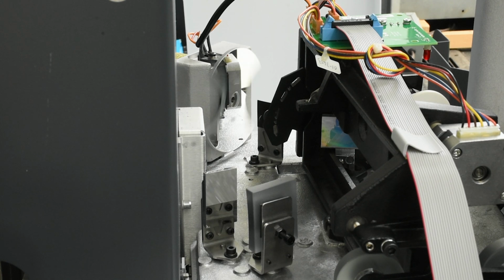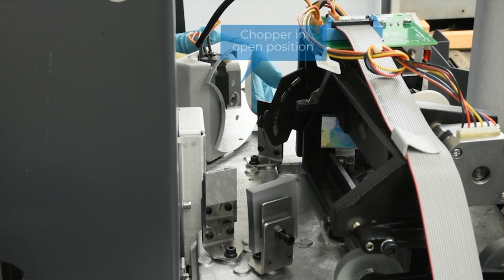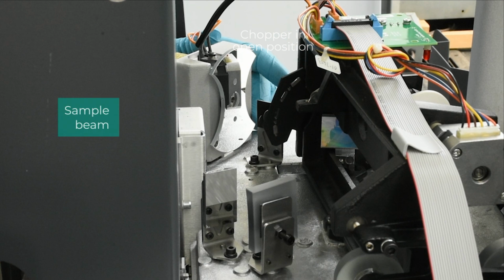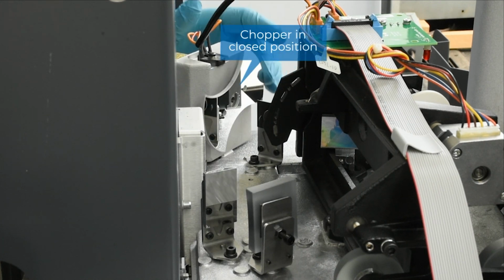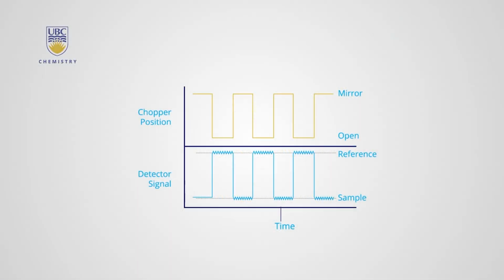After the burner compartment, the reference and sample beams come to the rapidly rotating chopper, which controls which beam enters the monochromator. In the open position, the sample beam is allowed to pass into the monochromator. In the closed position, the sample beam is blocked and the reference beam is reflected instead towards the monochromator. The rotating chopper means that the photomultiplier tube measures the light intensity alternately between the reference beam and the lower intensity sample beam. This double beam setup helps account for fluctuations in lamp intensity.